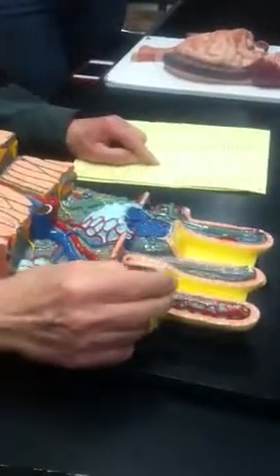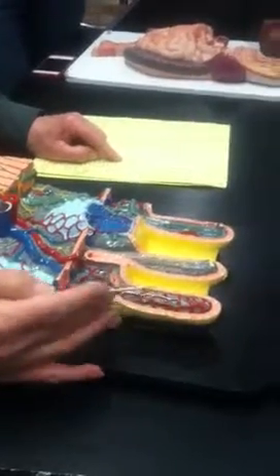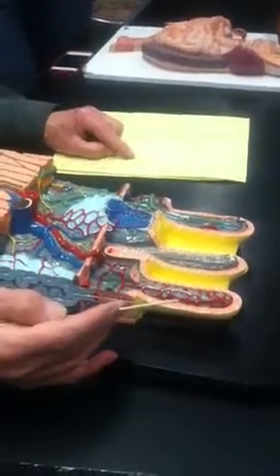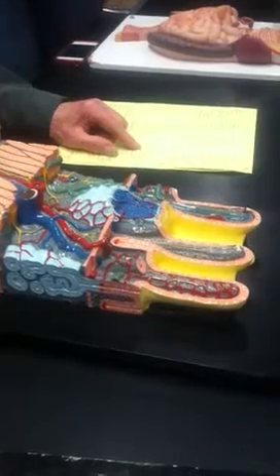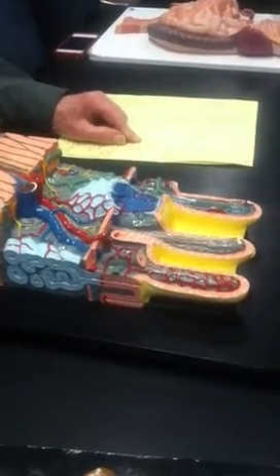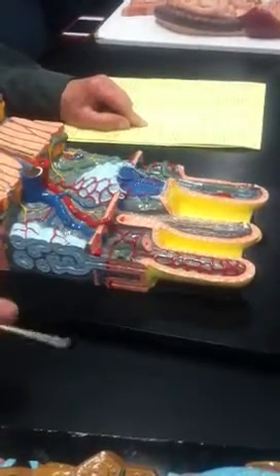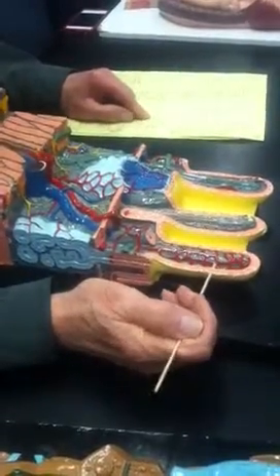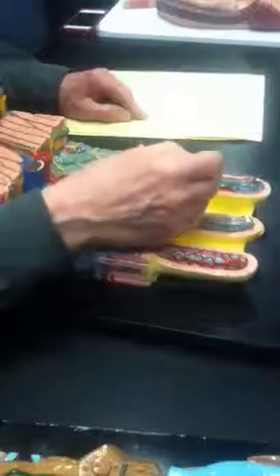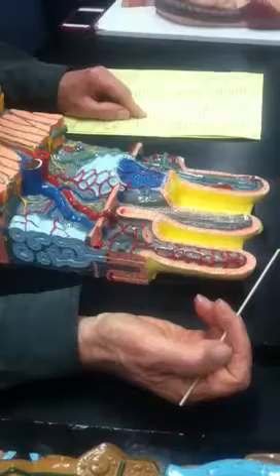Here are villi, and each villus contains a capillary net. That's the second item on the list, a capillary net for absorption of nutrients. Then we have an arteriovenous anastomosis. Wherever an artery goes directly to a vein without benefit of capillaries in between, that's called an arteriovenous anastomosis. Let's see if we can spot one here. On the blue part, right here, a vein and an artery: arteriovenous anastomosis.